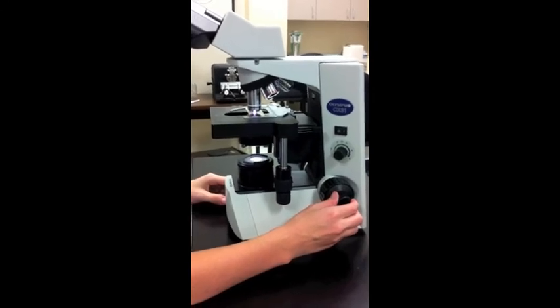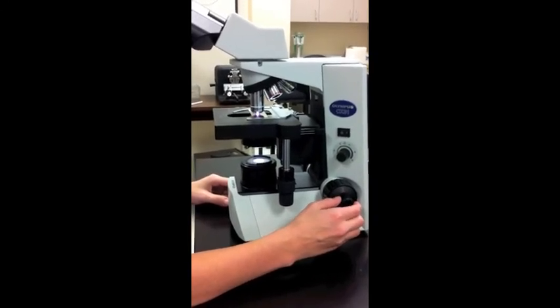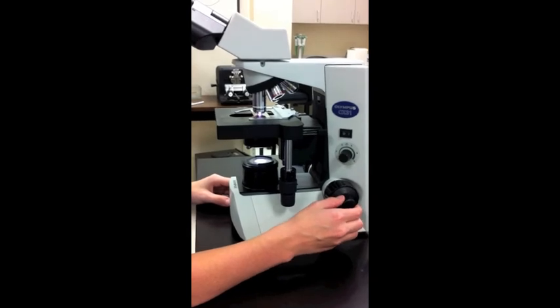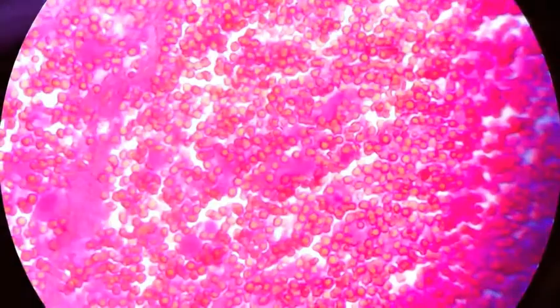Fifteen, use the fine adjustment knobs to clearly focus your specimen. This slide shows 100X objective with immersion oil in magnification.